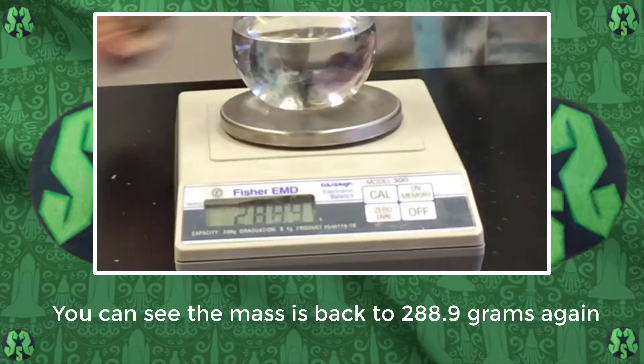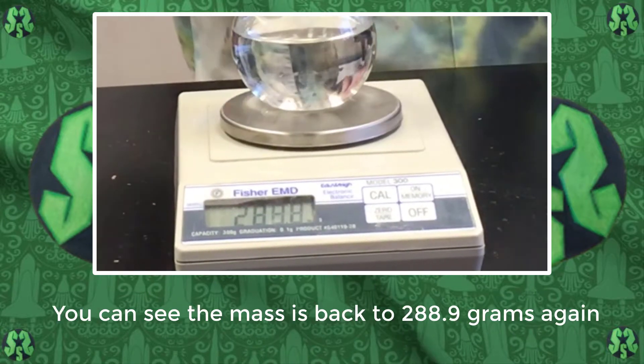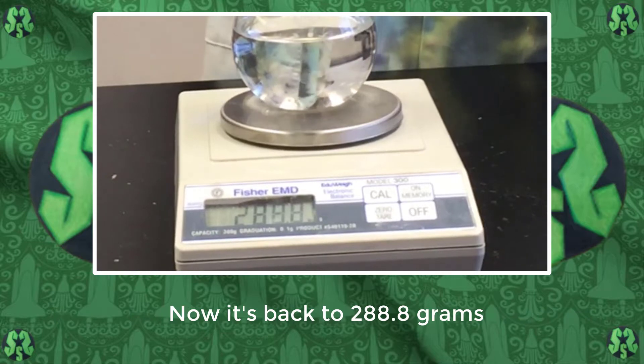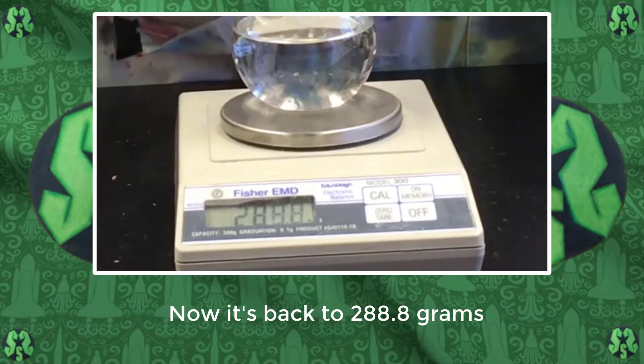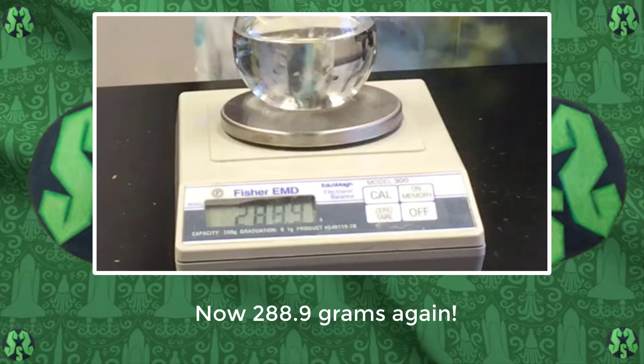I think I'm breathing on it. This balance is really sensitive - me just breathing on it is going to change it. I can move the air around and that will actually change things too.